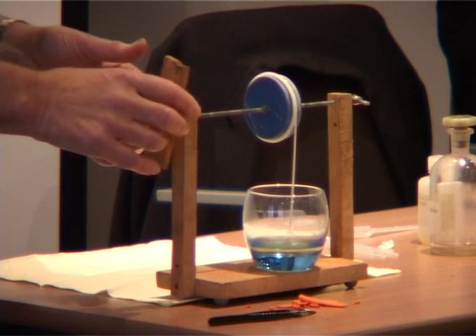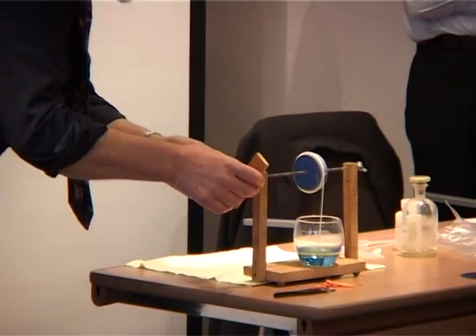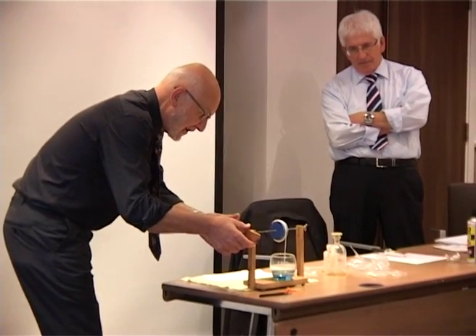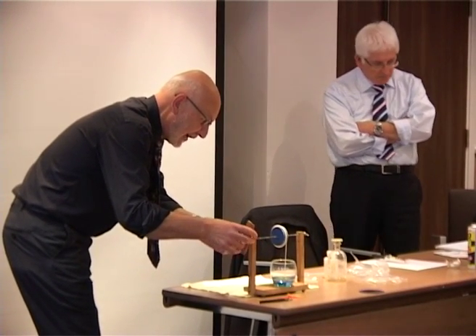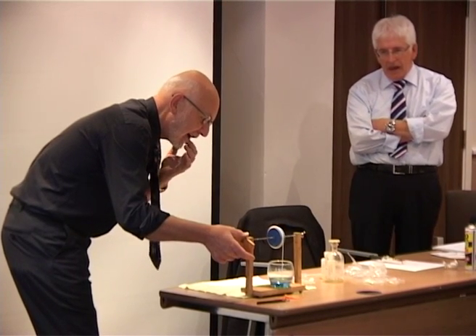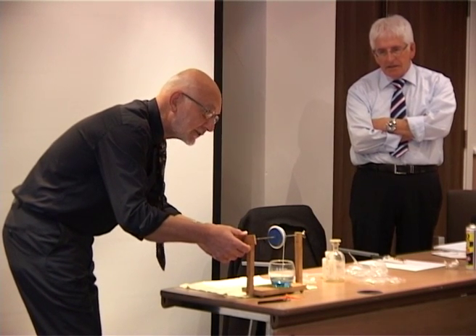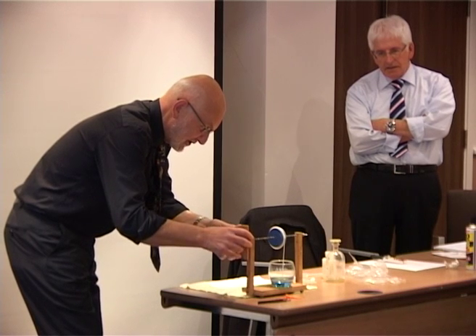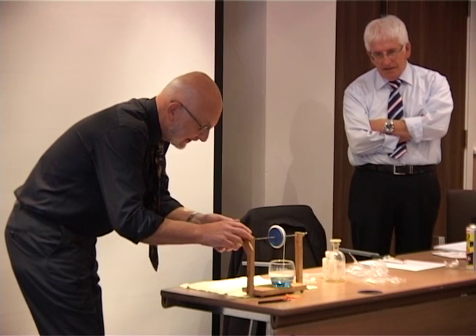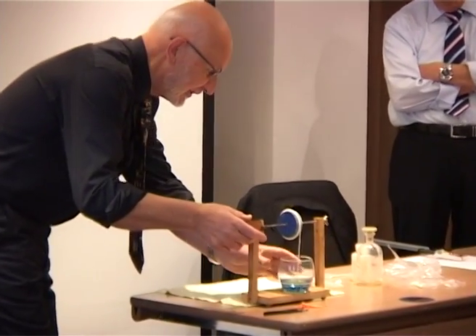Now this reaction is going on at room temperature. It's between an acid chloride and an amine rather than a diacid and a diamine. So it takes place very readily for that reason. Also, we're getting some additional assistance from the diamine because some of the diamine is actually being wasted, in a sense, and it's soaking up the hydrochloric acid which has been given off in this condensation process. That's removing it from the scene of the crime and enabling us better to form this polyamide.